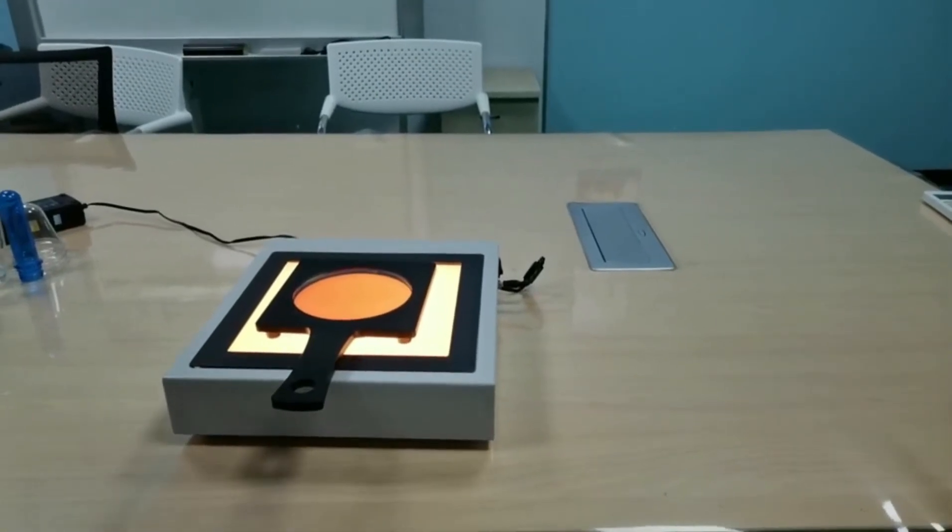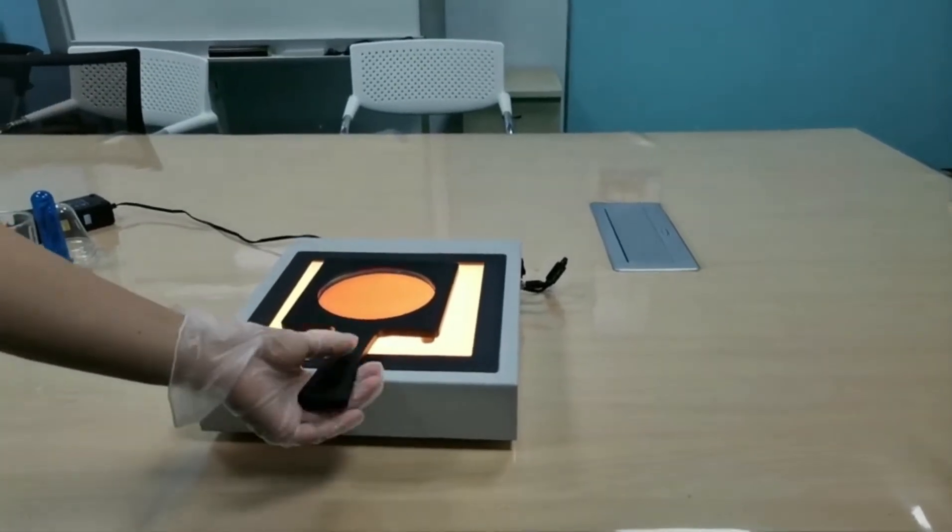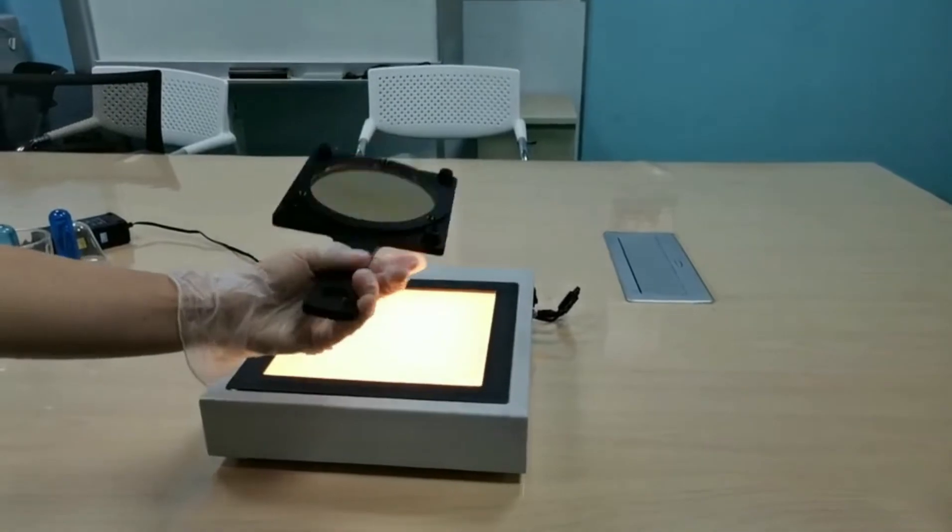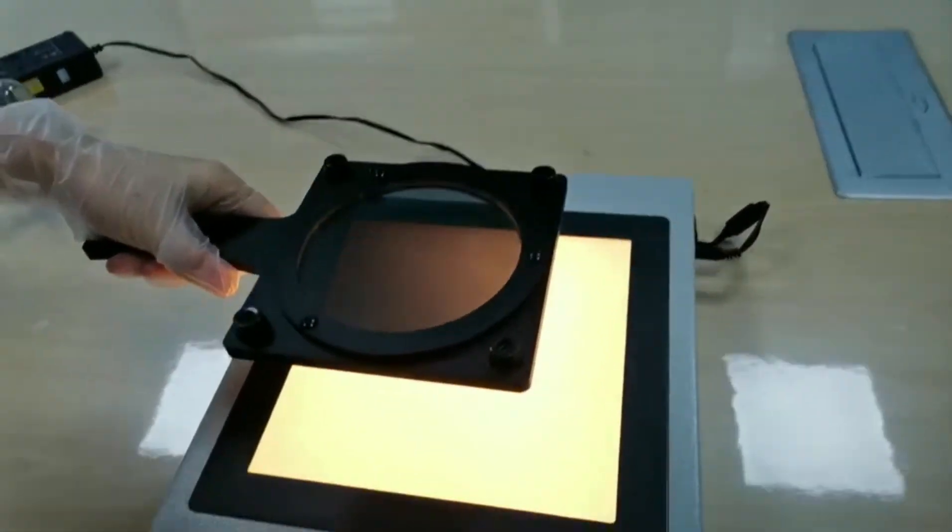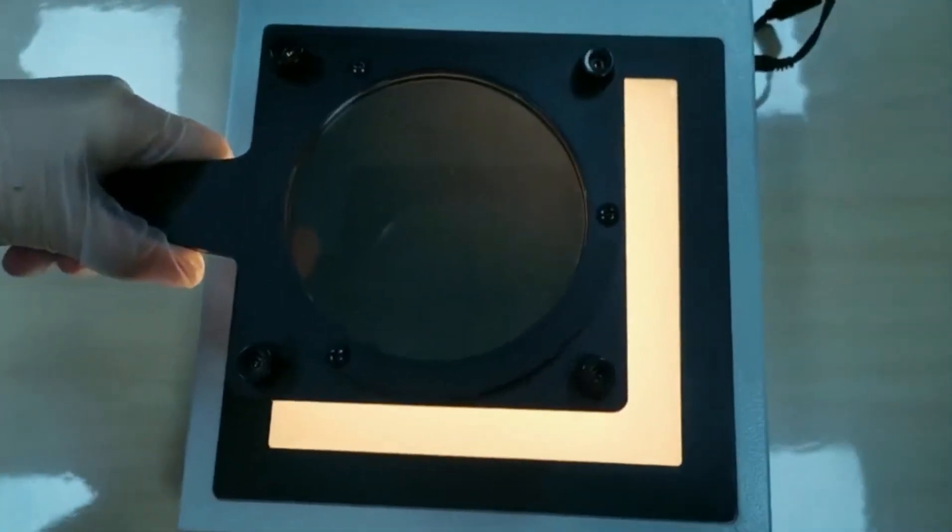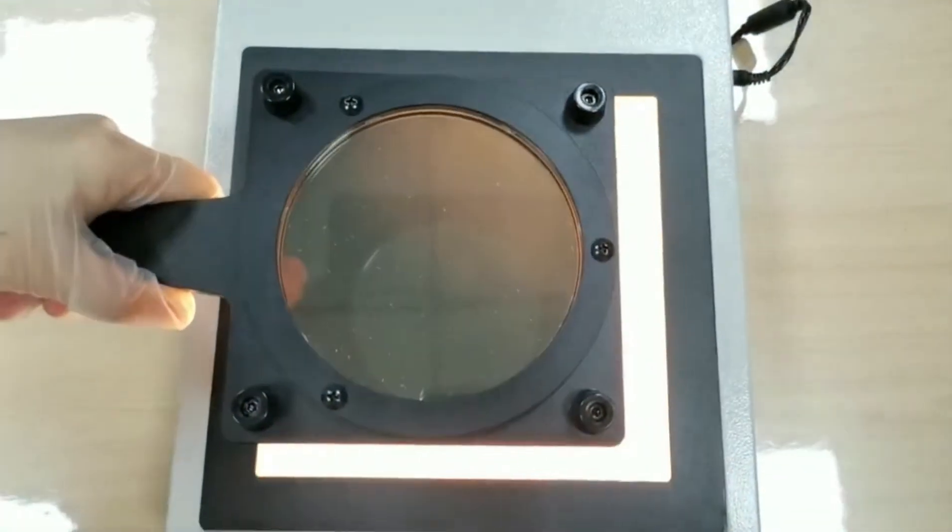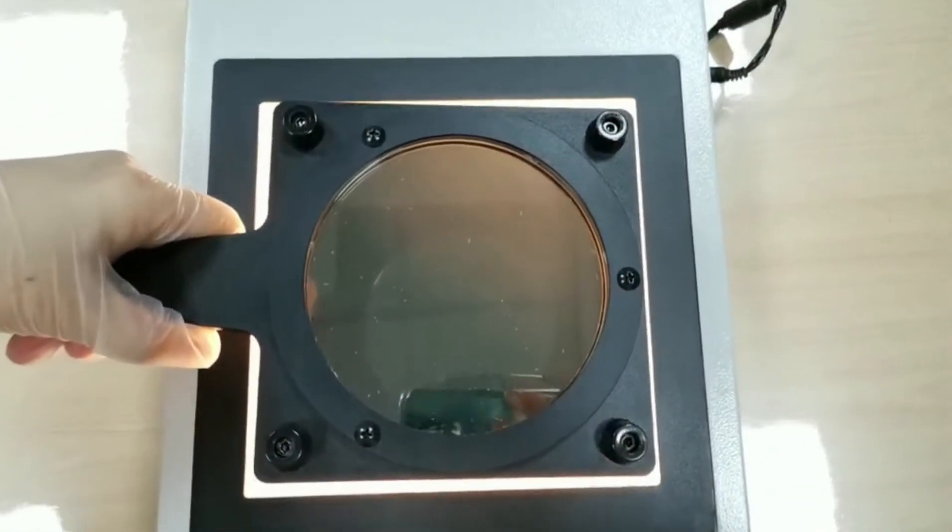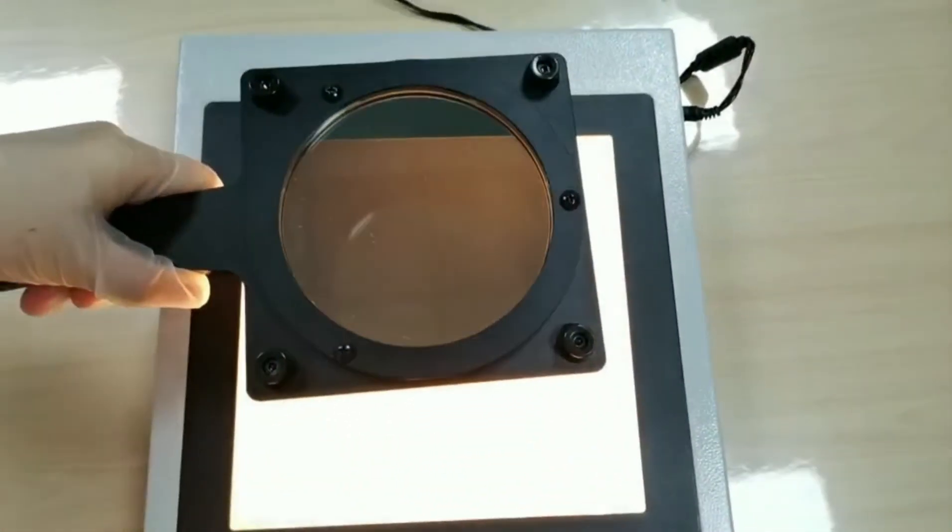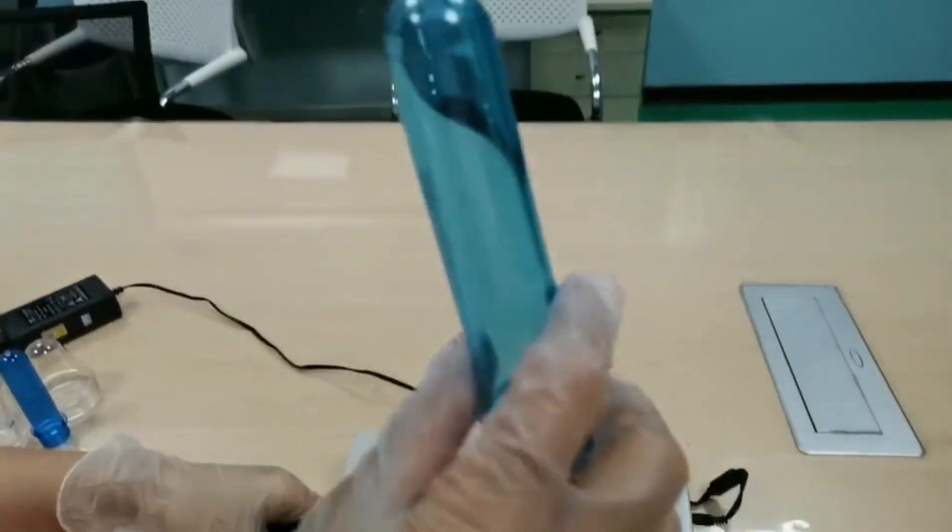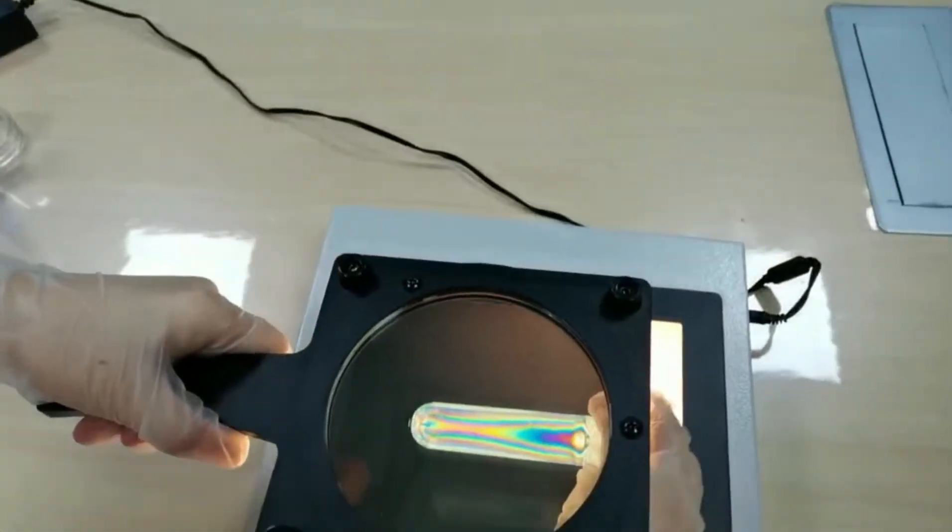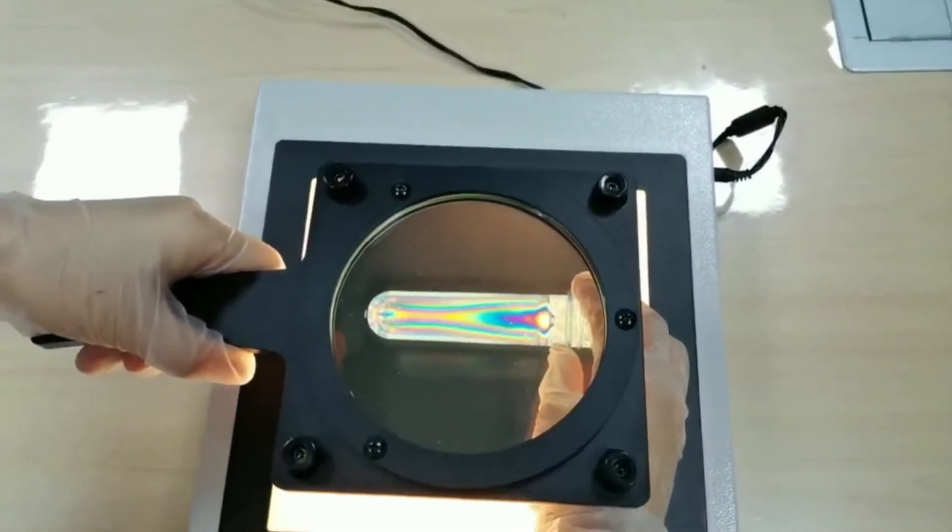Here comes the highlight. Let's turn over the analyzer and turn to another 90 degrees. When we see from the top analyzer, the field of view turns black. Let's check these blue preforms with this handheld polariscope. Now, putting it between the analyzer and polarizer.